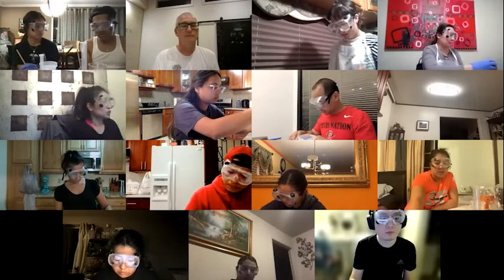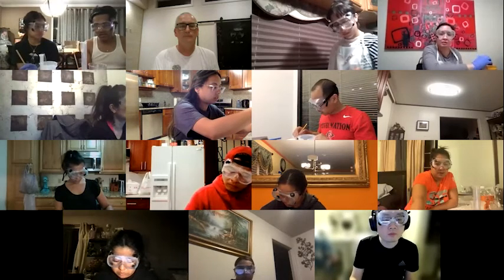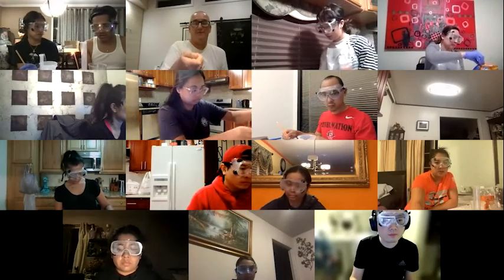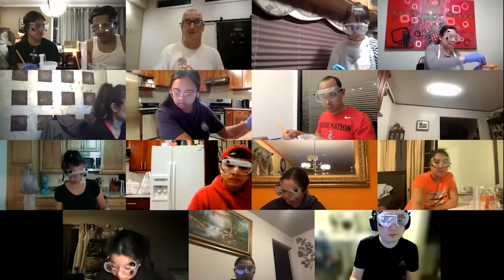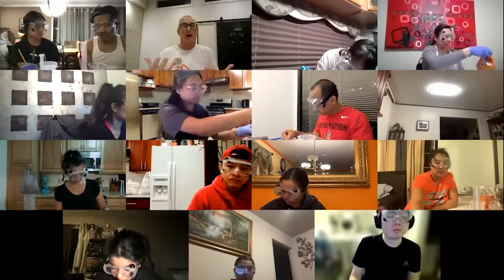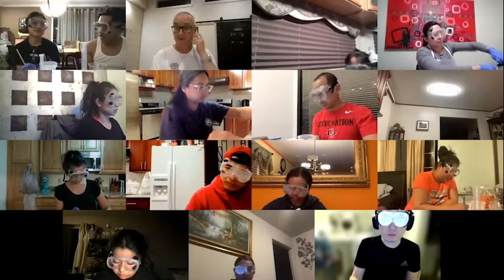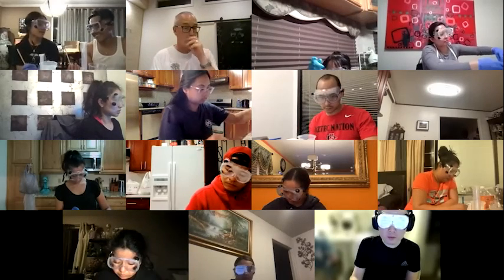So there was nothing because of the CO2 and no presence of oxygen. And then when you light it, there's presence of oxygen. If you put a glowing splint in the presence of CO2, it's not going to do anything. It was out, it's going to continue to be out. Basically, CO2 is used as a fire extinguisher, right? So it's not going to reignite something.